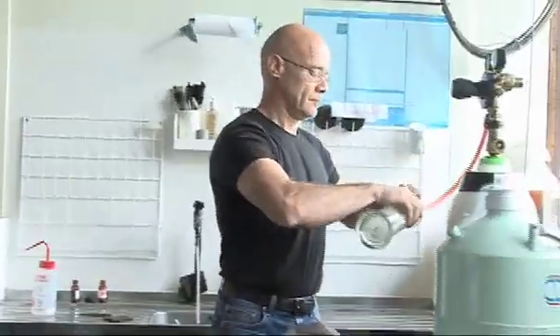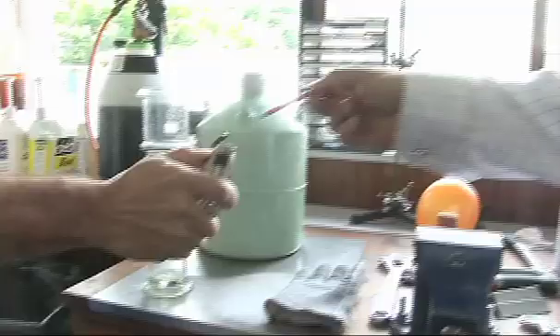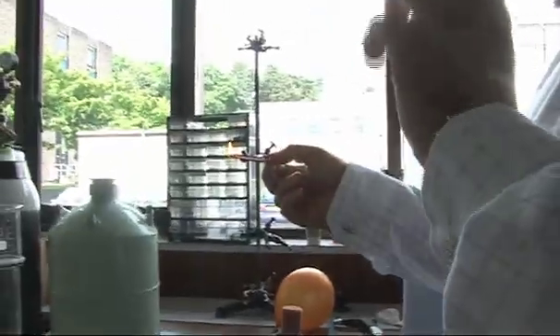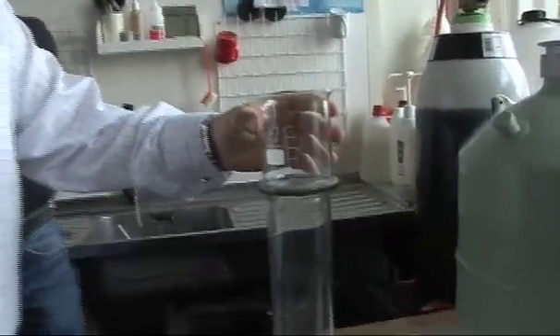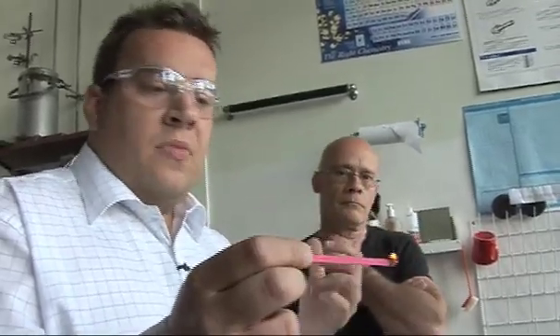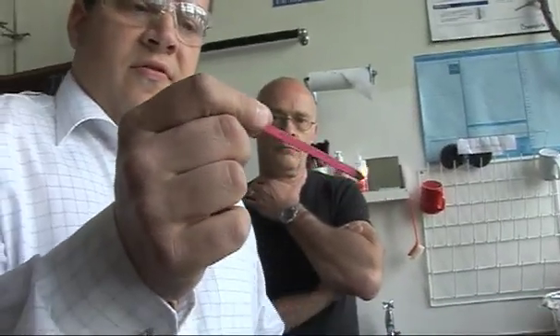Neil's now connecting a piece of tube to the oxygen cylinder and filling a gas jar with oxygen. We're going to do the classic experiment everyone learns at school to test for oxygen: relighting a glowing splint. So here we're burning a splint — wood burning in excess oxygen. Now we take the splint out so it's just glowing. If I blow on the splint, you can see it gets brighter. We put the glowing splint into the oxygen-rich atmosphere and the flame comes back to life. The increased oxygen concentration reignites and re-initiates the oxidation of the wood. Let's do that again — flame again.